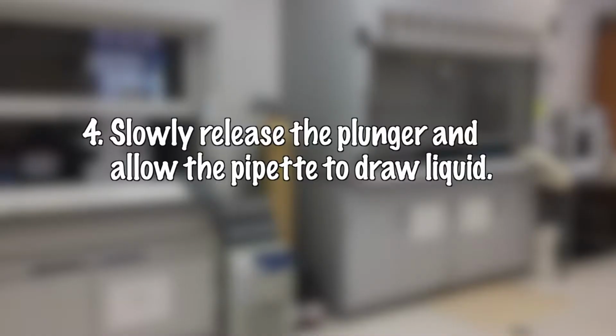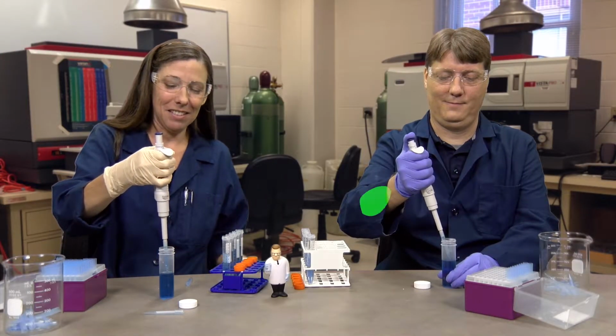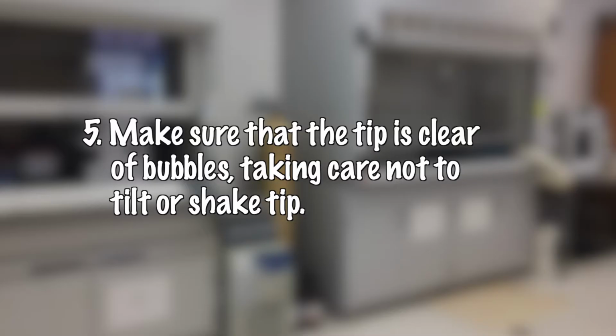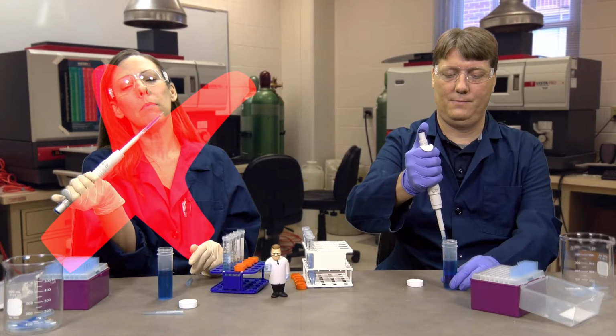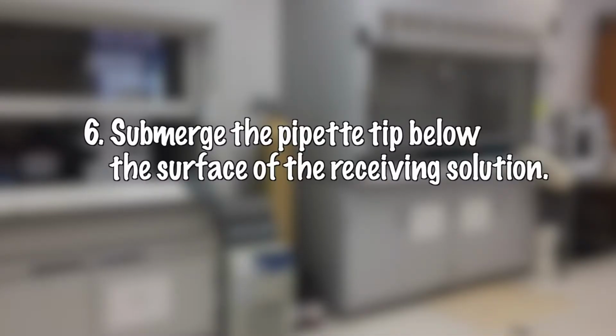Step 4, slowly release the plunger and allow the pipette to draw liquid. Step 5. Make sure that the tip is clear of bubbles, taking care not to tilt or shake the tip. Step 6. Submerge the pipette tip below the surface of the receiving solution.